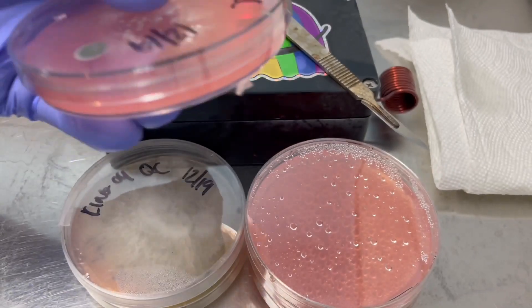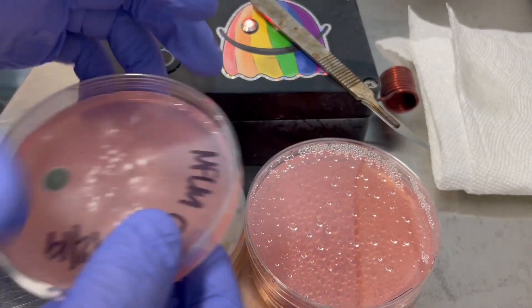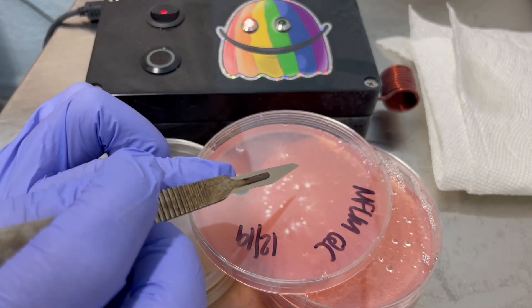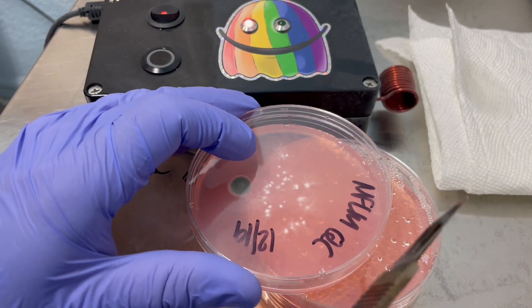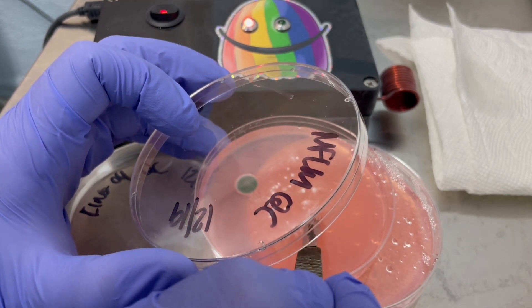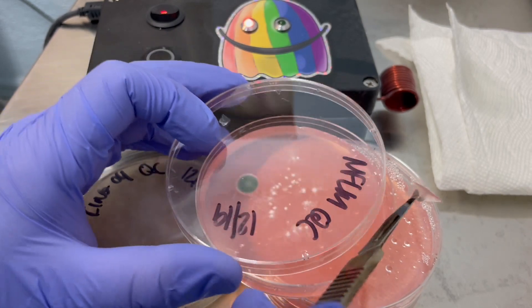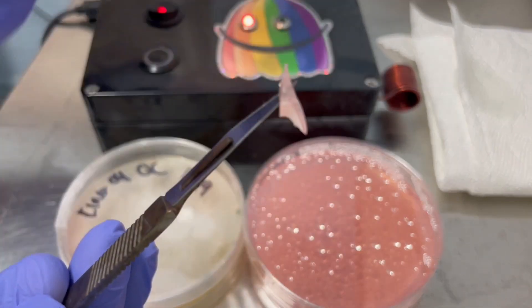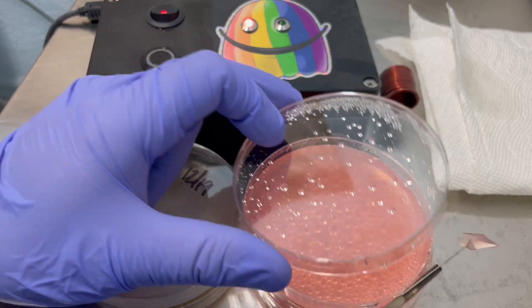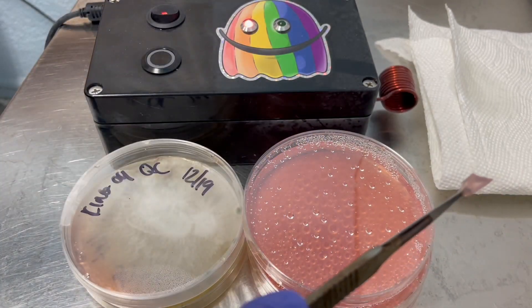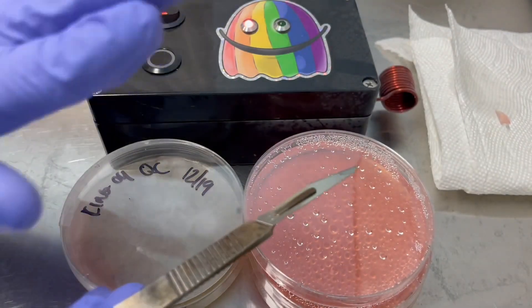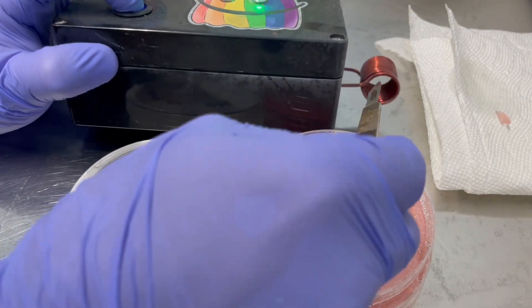And I'm going to be careful to keep this colony far away from my workstation. And then I'm just taking my parafilm off the dish so I can open it and very carefully, without really disturbing that other culture, I'm going to take a cut from this mycelium in this clean section here. So it doesn't have to be huge, just like that. And then I'll put it on that clean petri dish, whoops, it looks like I whacked the edge there. So I'm actually not going to use that piece and I'll carefully just put that off to the side. So that's another tip is if you have any doubts, start over.